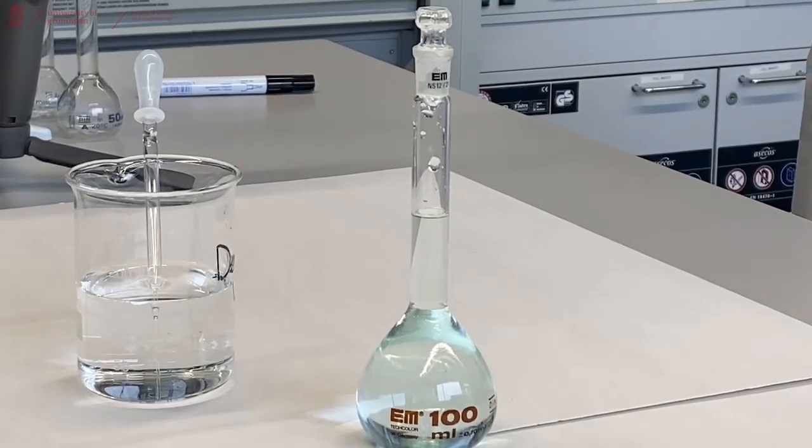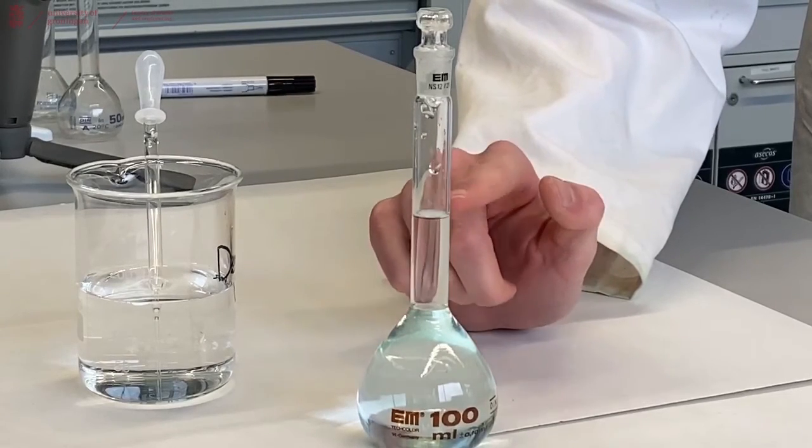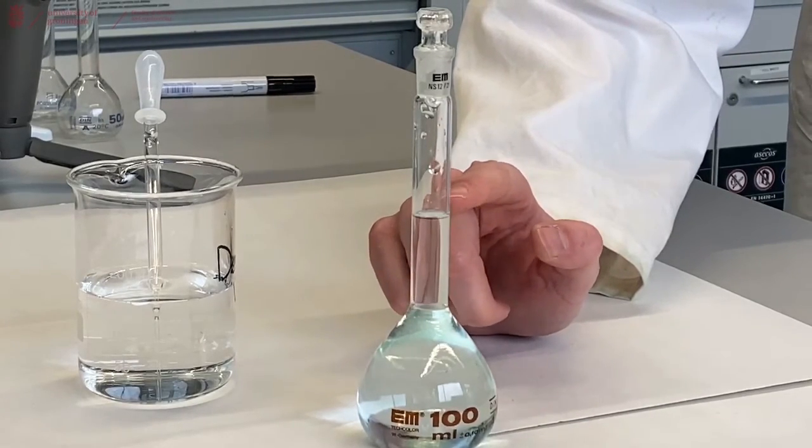So now that it's been mixed properly, you can see that the neck is a bit wet, but that doesn't matter anymore because we already set the volume before mixing.